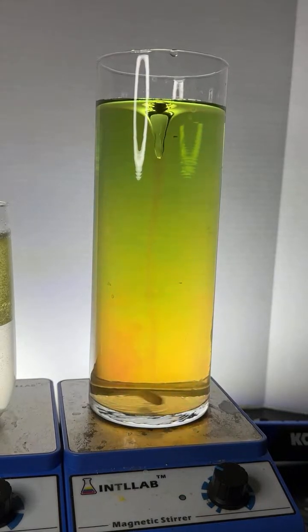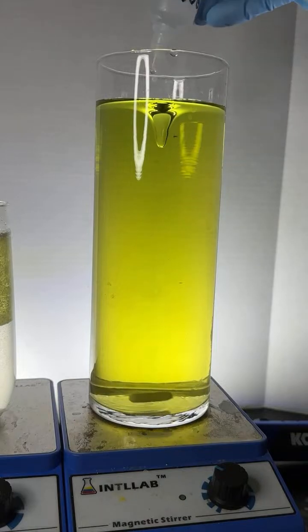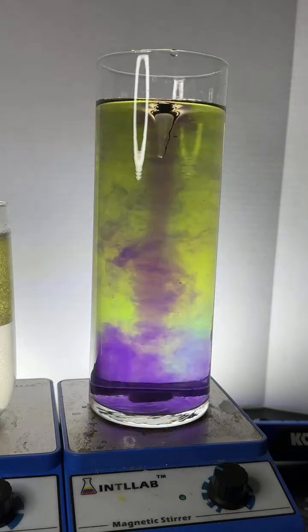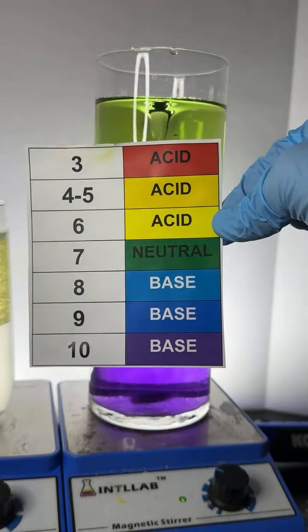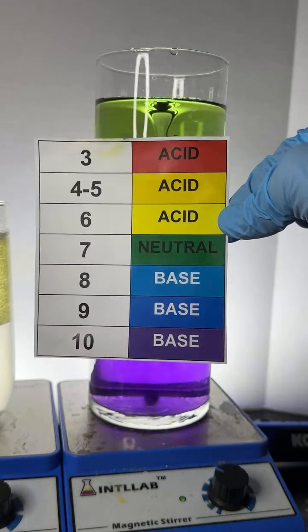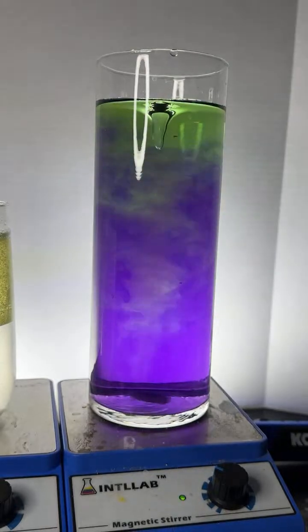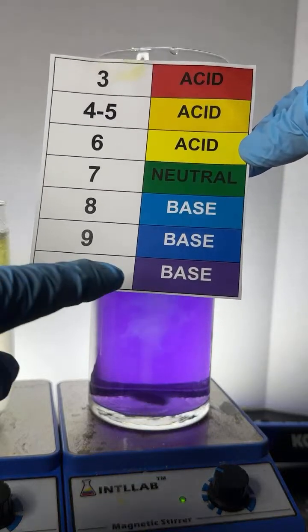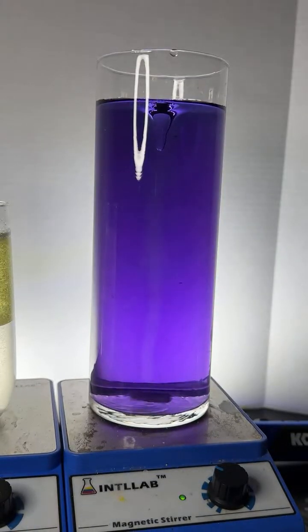Oh, Fred, so this is what's going on, Fred. So here we go. In this flask here, I have a mixture of chemicals known as universal indicator. Universal indicator changes color depending upon pH, which is just how acidic or basic something is. So, in this particular flask, the universal indicator will show these colors at different pH values. Most of the flask here, once it sort of homogenizes, you'll see it's violet, which means we're at pH 10, which is very basic. I'm now going to start adding acid to the flask, which is going to lower the pH, and you'll watch the color shift accordingly.